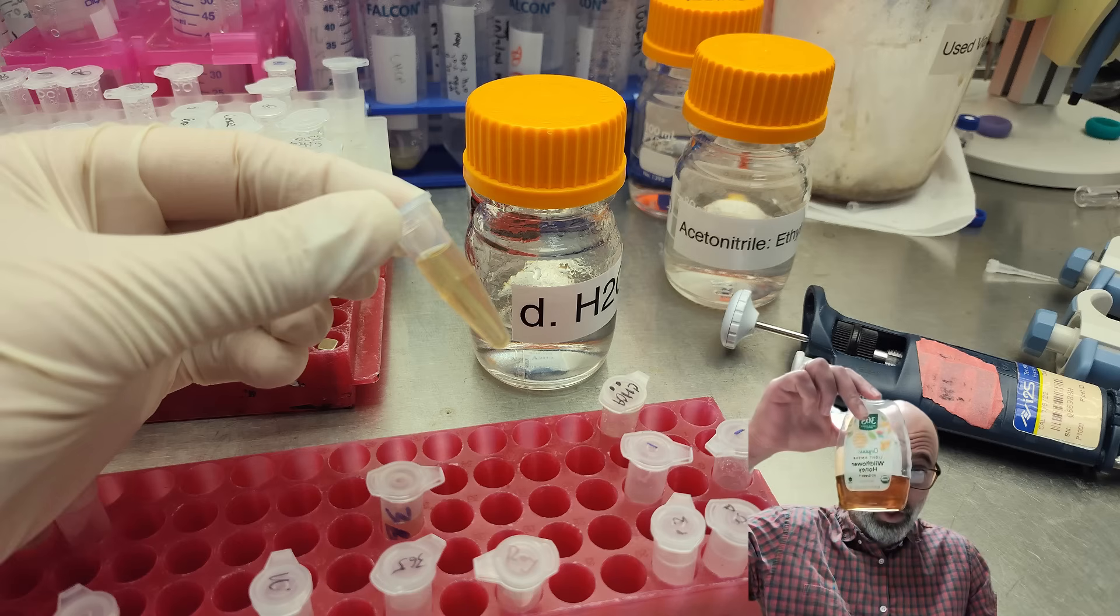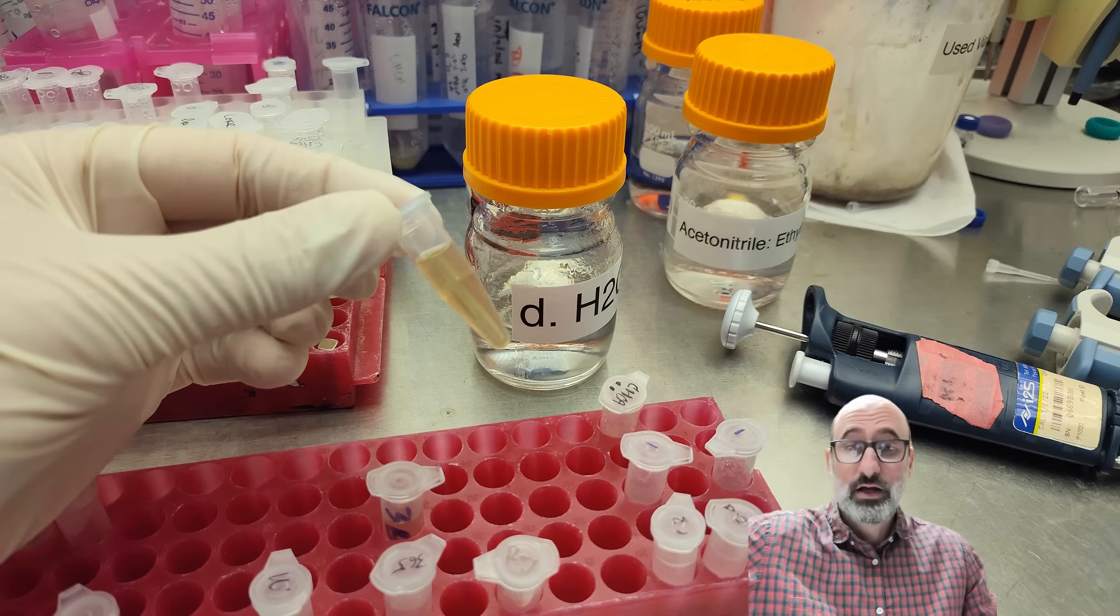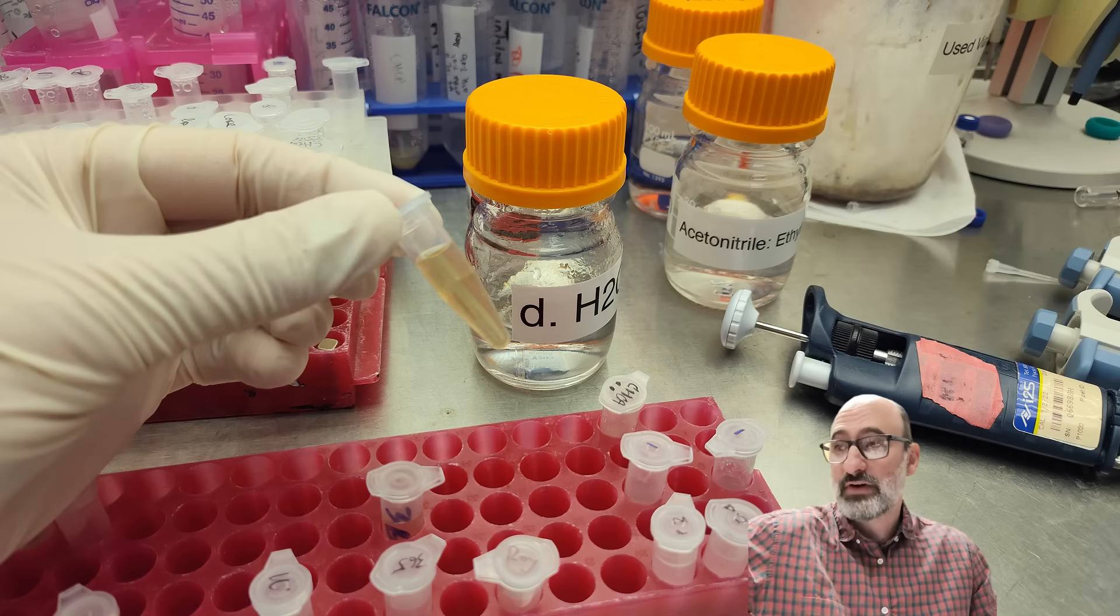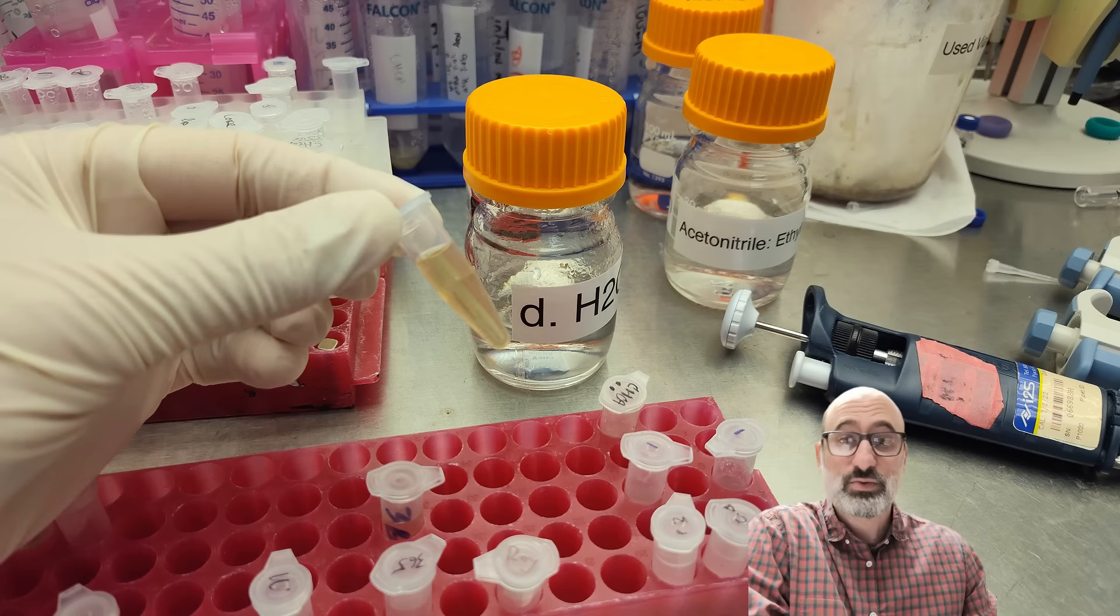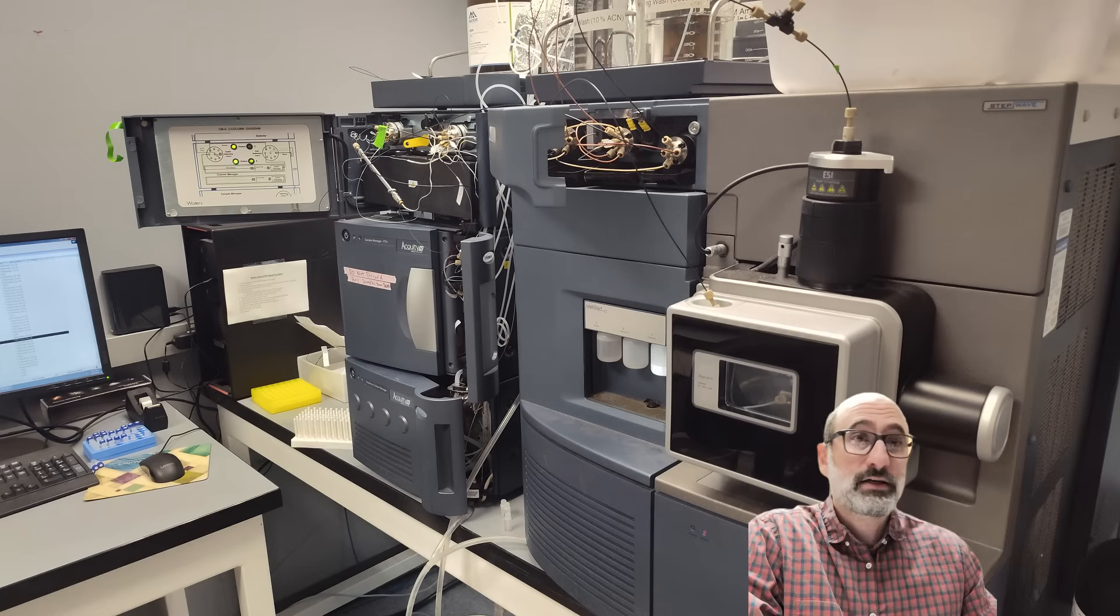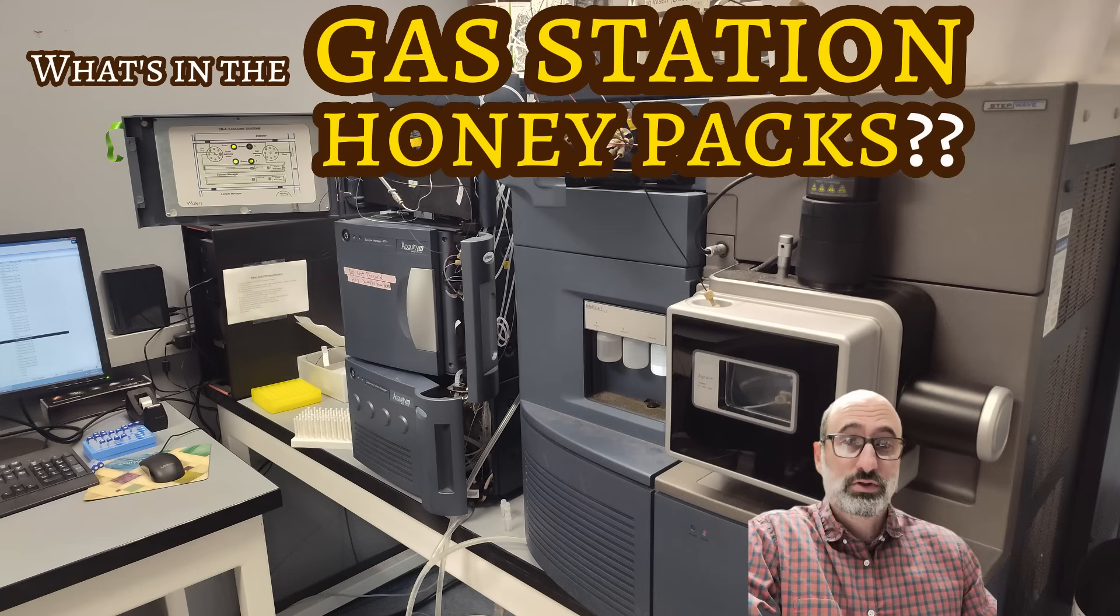We're diluting it in clean water, and then we're running it versus some honey. We're just going to do the wildflower honey from Whole Foods, the 365 wildflower honey. It's not the best honey in the world, but at least we know that it is honey and consistent in honey molecules.